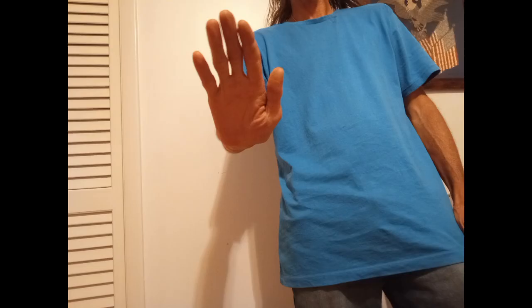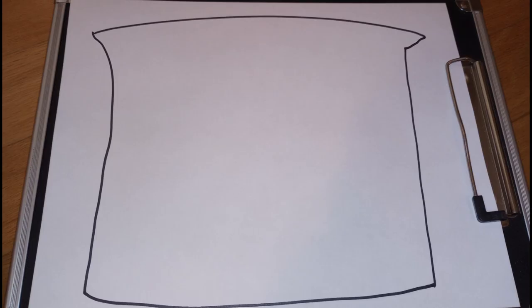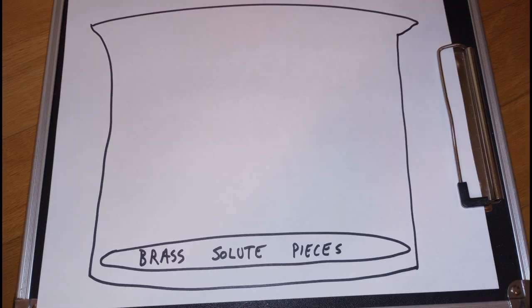And this is the sediment — it's kind of hard to see but it looks like a gray powder. "Hey, wait — this is taking forever and it doesn't seem like you're getting anywhere. Do you know what you're doing?" Well, this is a learning experience for me, so I'll tell you what I think is happening.